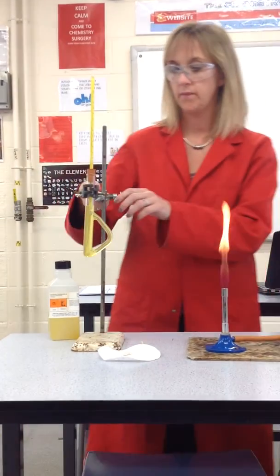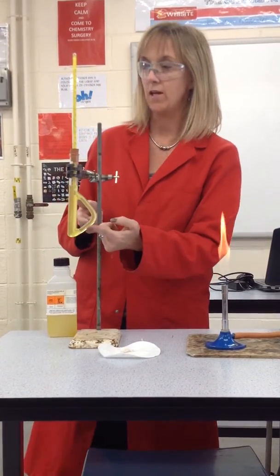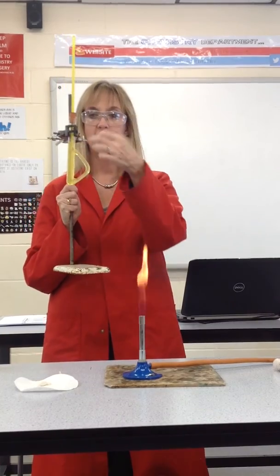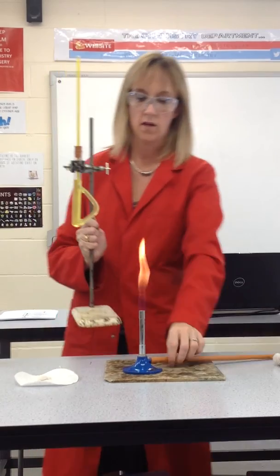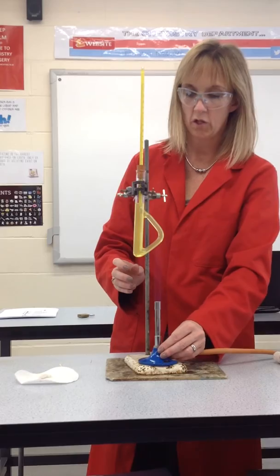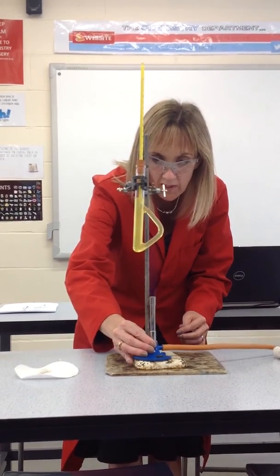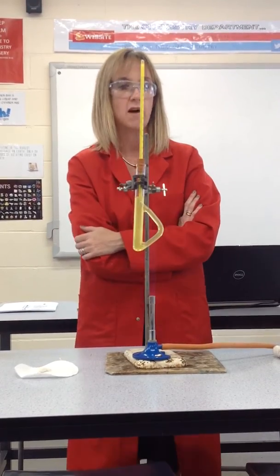Make sure you can see the crystals really clearly and you can see the scale on the thermometer. When you're ready and you've checked the height of the Bunsen, you're going to heat it at the lower part of the tube. By heating it at this point, you're going to create a convection current that goes around the dibutyl phthalate and heats the thermometer and the crystals nice and evenly. Use quite a gentle flame and you'll be able to see the convection current starting — it's really nice, you can actually see it moving around. The temperature will start rising on the thermometer.